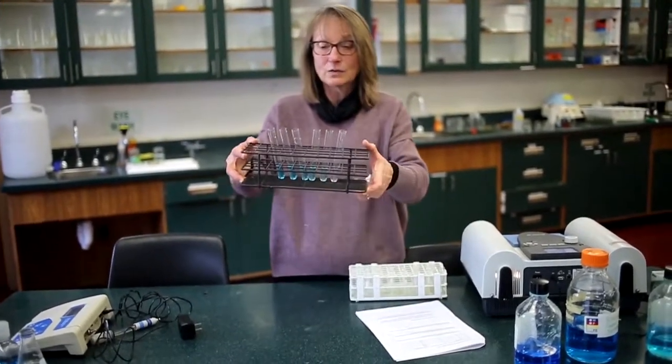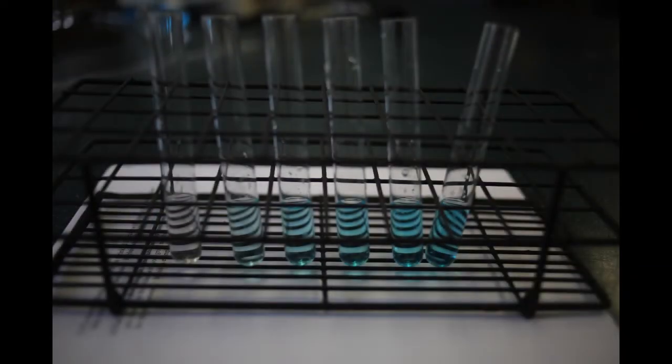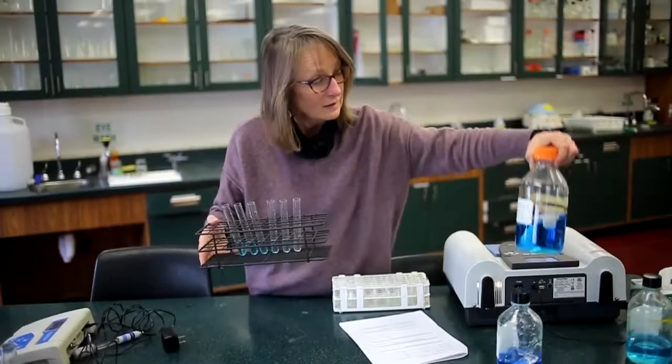So what we are going to be doing in class, and what we've done for you all, is created a dilution series using a known concentration as a stock, and we chose this one, I think 0.25 molar copper sulfate. So we know that because we've used chemistry and weighed it out and made a solution that we know.